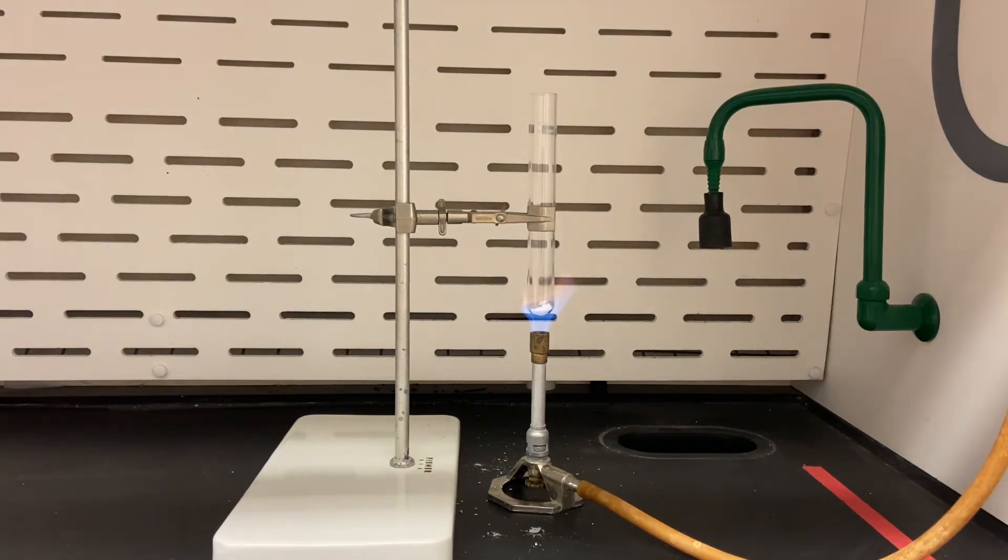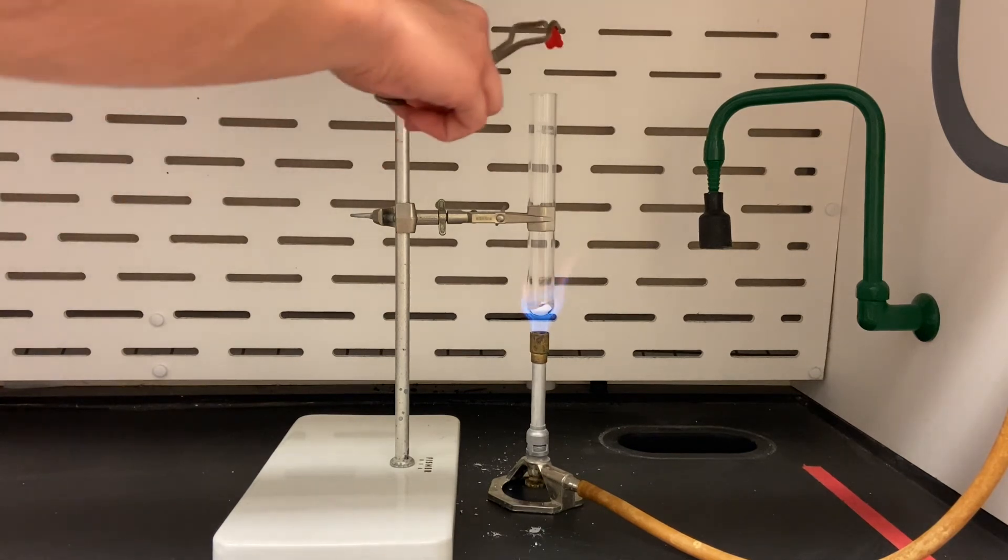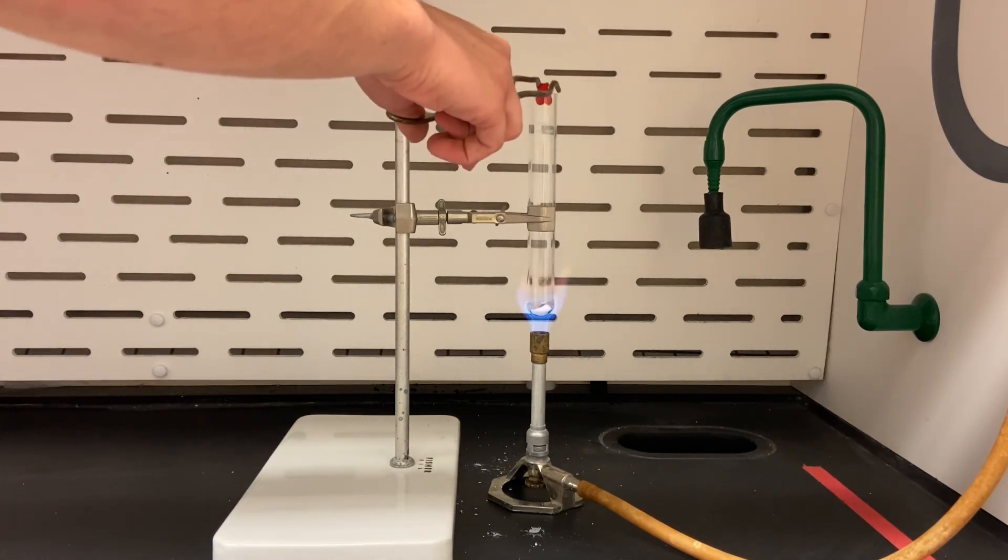All right, so we have molten potassium chlorate. So at this point Adam is going to reach in here. He's going to drop that gummy bear straight down in and let's watch the fireworks.